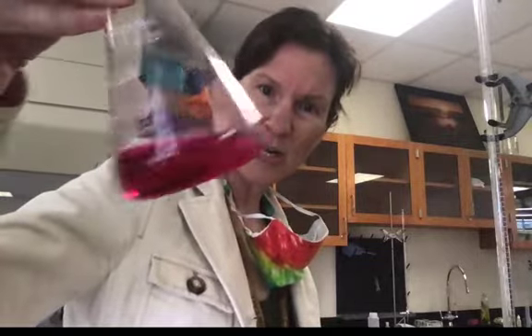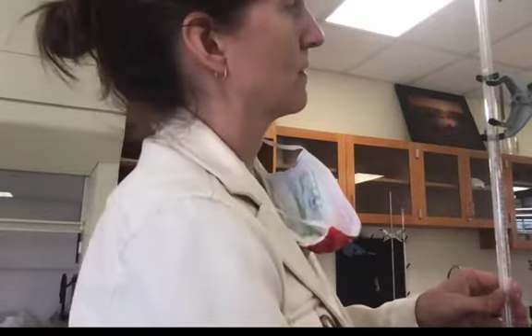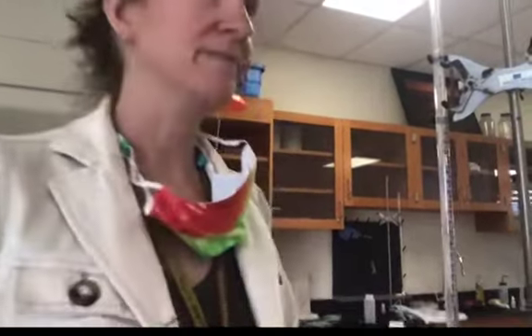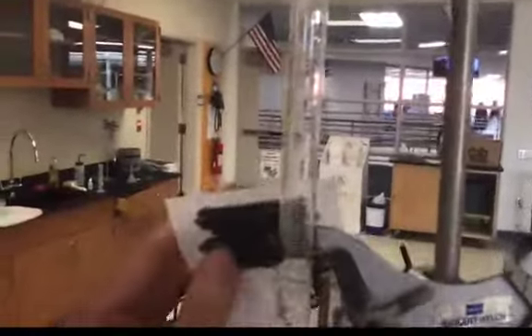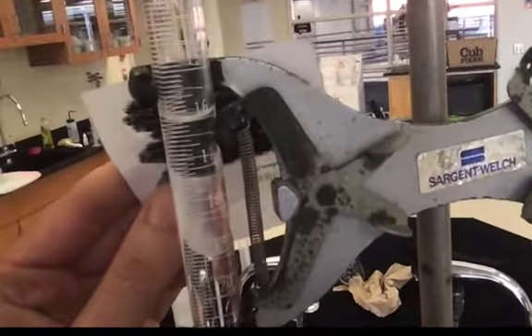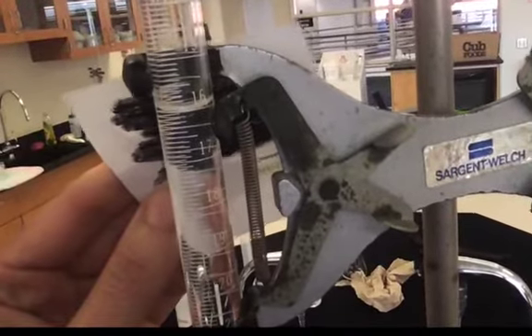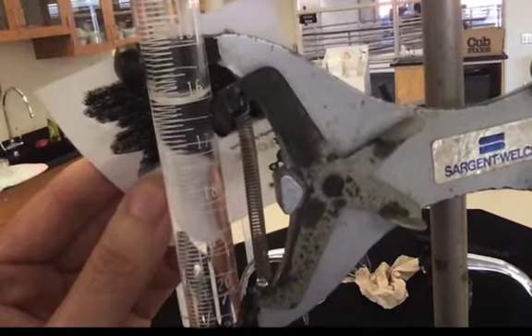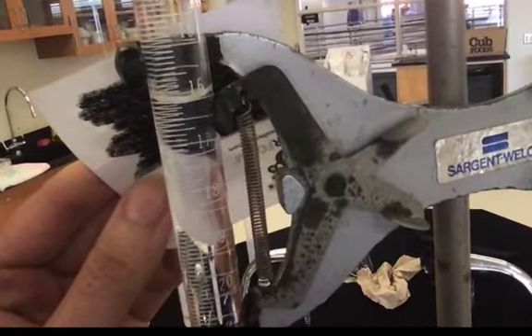Final color for your first trial. Final burette reading for that first trial. This will also be your initial burette reading for the second trial.